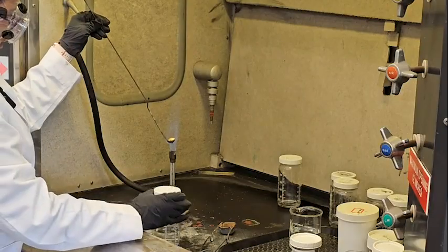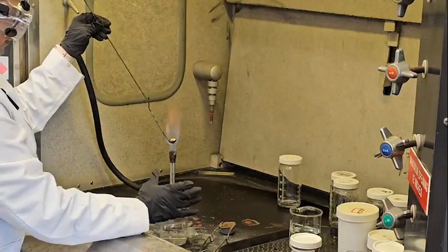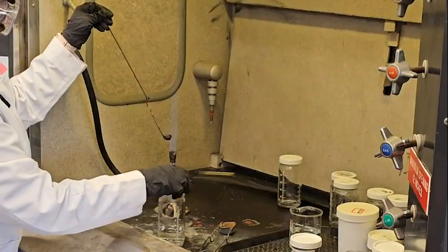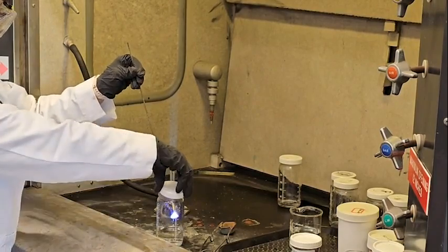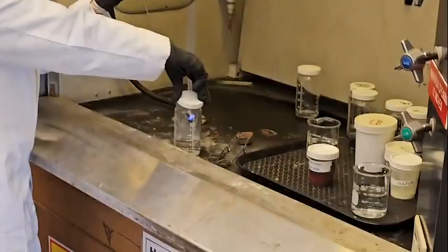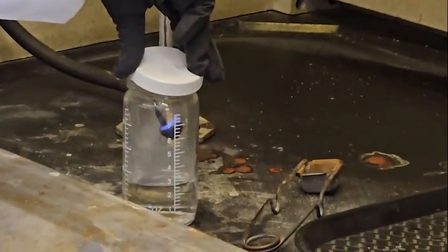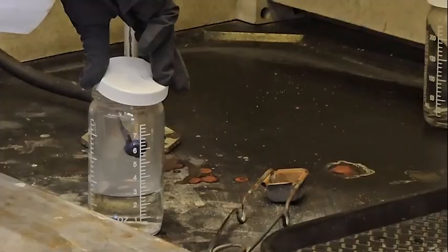Okay, it's burning. You can see there is no flame change, right? We are putting it here. Wow, there is a color. So sulfur loves oxygen. In the air it doesn't make that much flame, but when it contacts the oxygen, it has a bluish color.